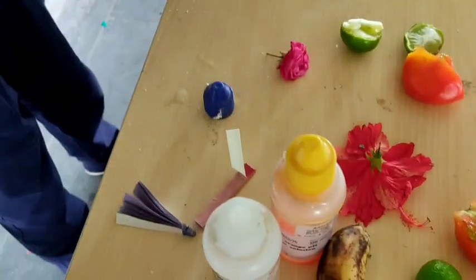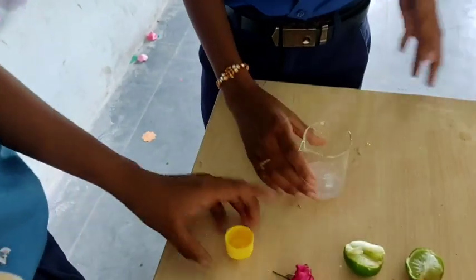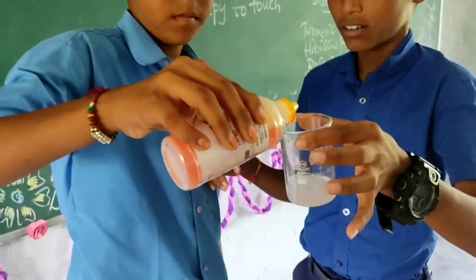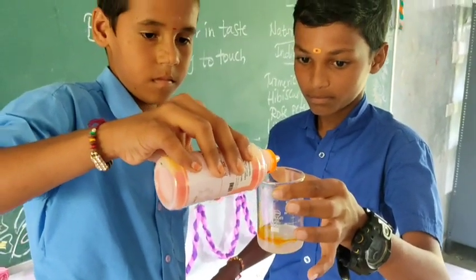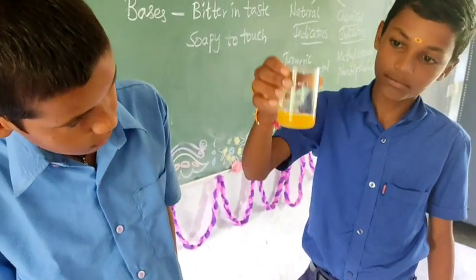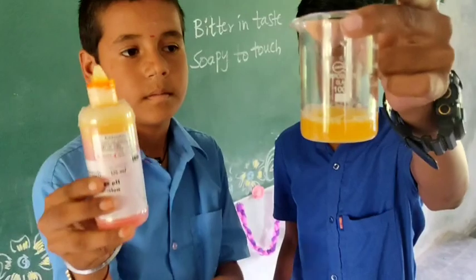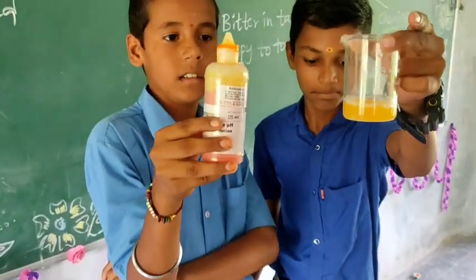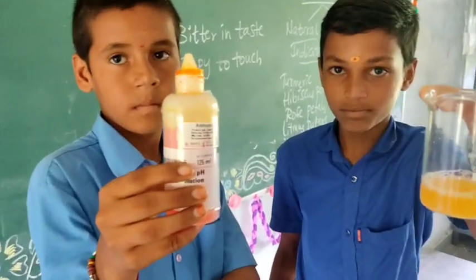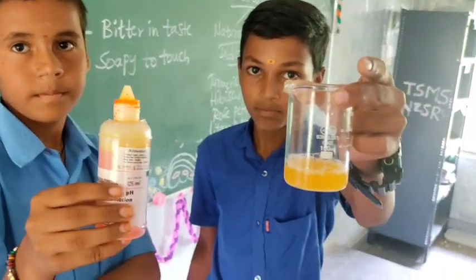Now we will test the Soap Solution with chemical indicators. First, we add a few drops of Methyl Orange into the Soap Solution. The Soap Solution has changed to yellow in color. With acids, Methyl Orange changed to red color, but here with the base, it is changing into yellow color. So we can confirm that the Soap Solution is basic in nature.